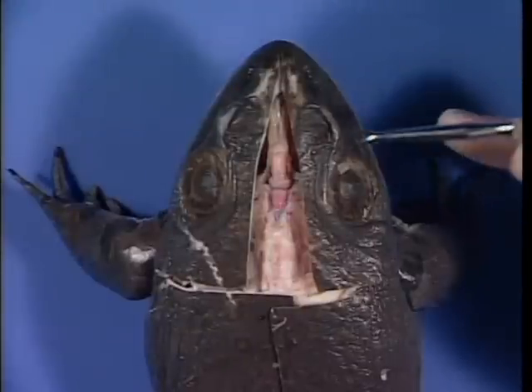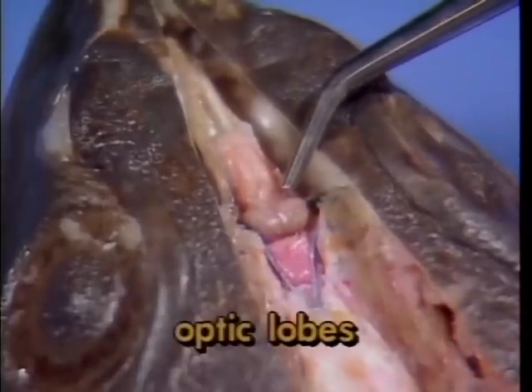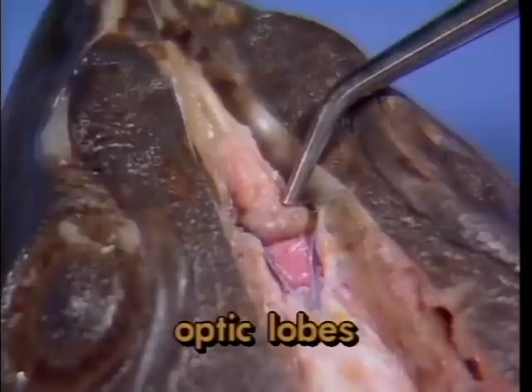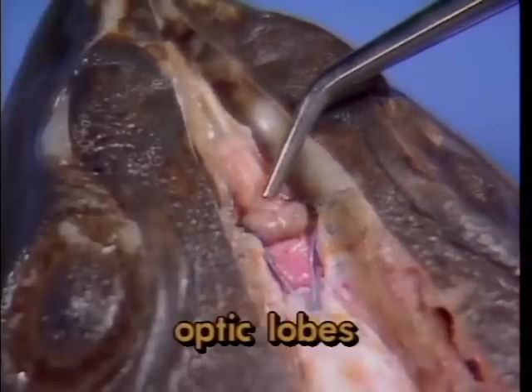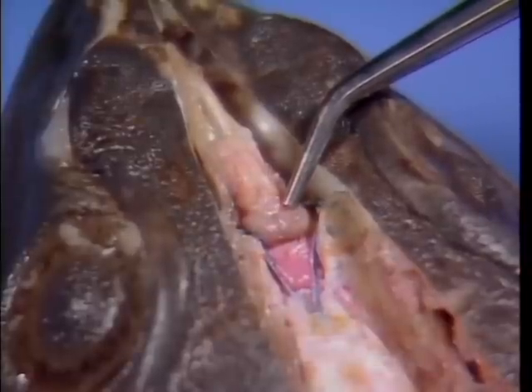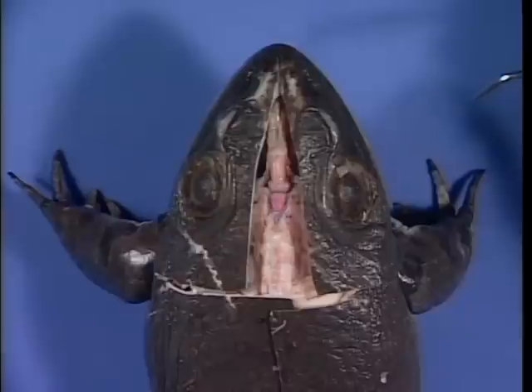Posterior to the cerebral hemispheres are two larger dorsal swellings called the optic lobes. The optic lobes are receiving points for sensory input coming from the eyes and function as an association center for other sensory input as well. In amphibians, portions of this region also contain the decision-making center of the brain.